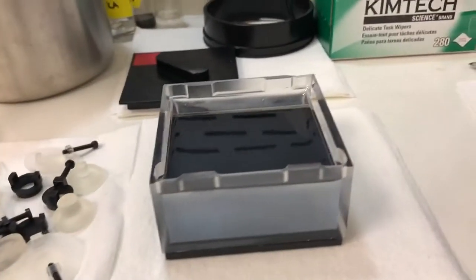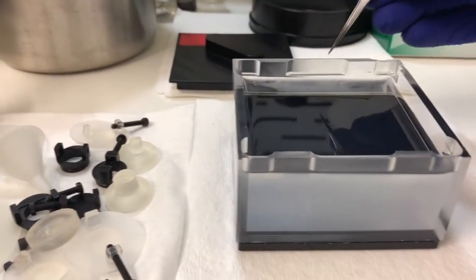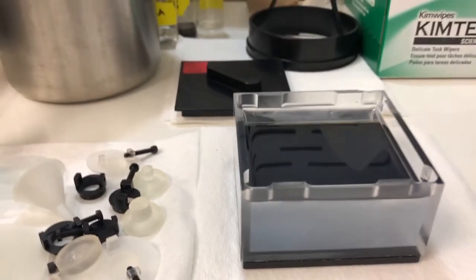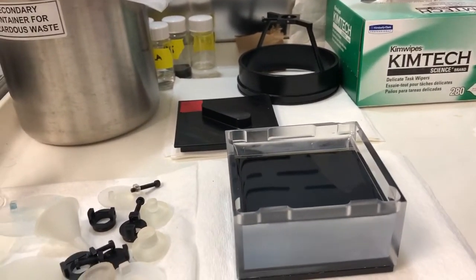Let me show you what that looks like. You can see the DBE level is right below there. It's perfect. Alright, so now I'm going to take that and put it back in the system.